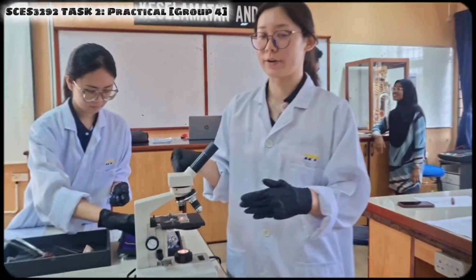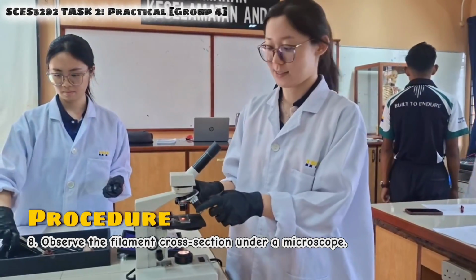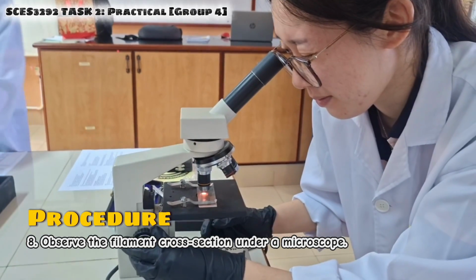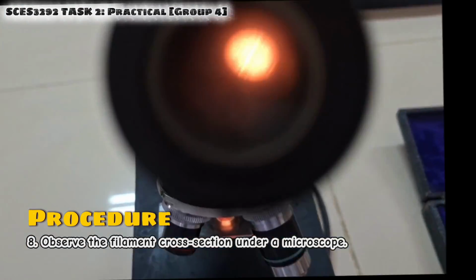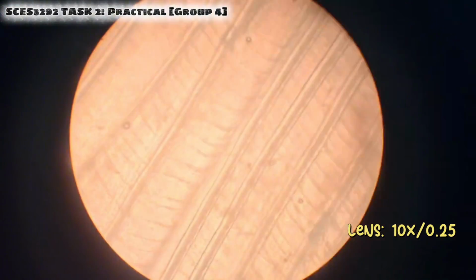Next we are going to observe the small parts of gill filaments using the 0.25 lens. Let's see. This is the gill filaments under the microscope with the 0.25 lens.